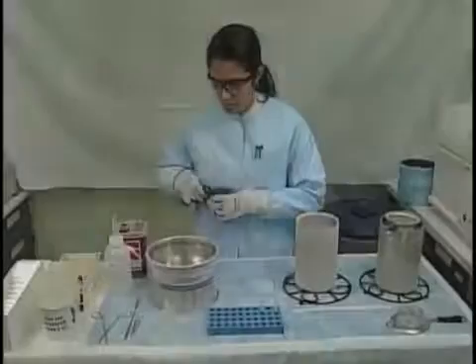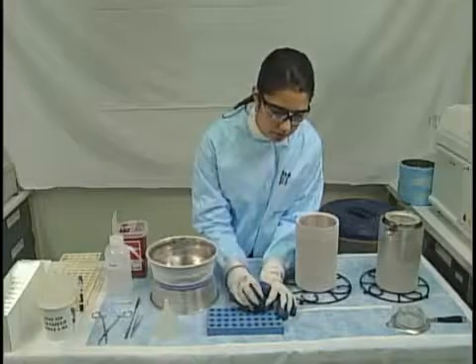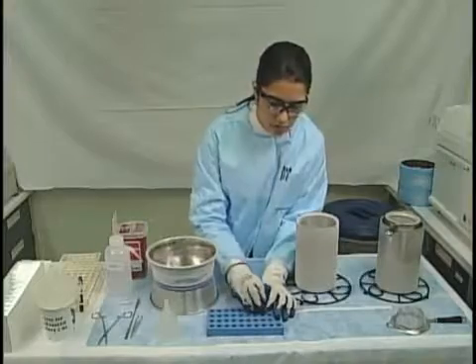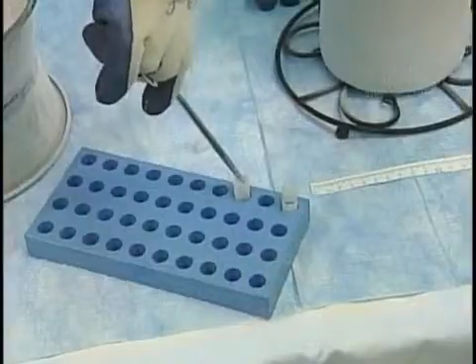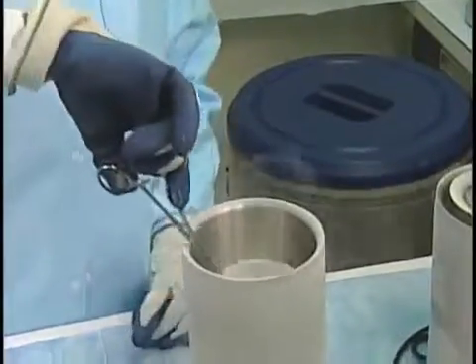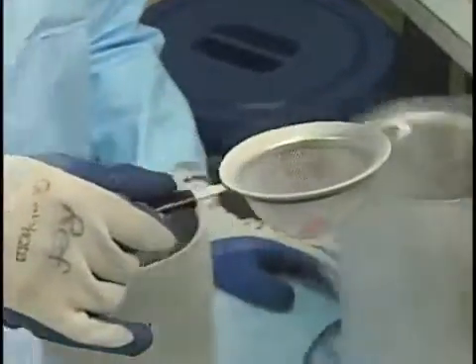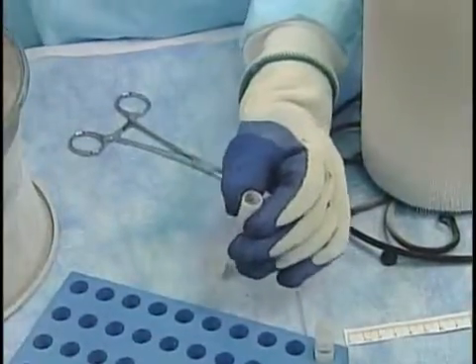Before transferring the droplets to a cryovial for long-term storage, puncture the cryovial's cap two or three times. If small amounts of liquid nitrogen get into the vials, these holes will prevent the vials from exploding in storage. Chill the cryovial and funnel in liquid nitrogen — this will prevent the droplets from sticking and thawing on contact. Use the funnel to direct the droplets into the cryovial. If droplets do stick to the funnel, moderate tapping may be necessary to dislodge them.